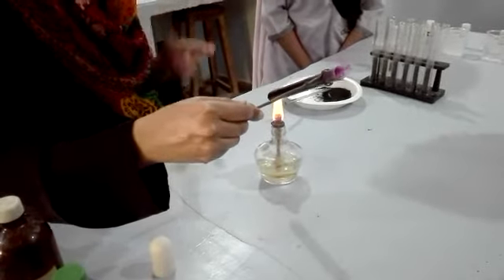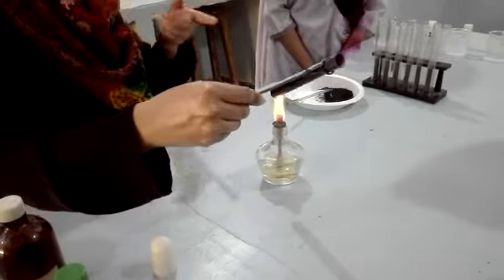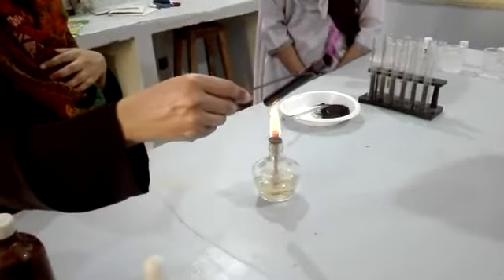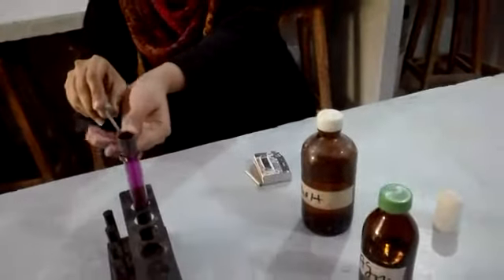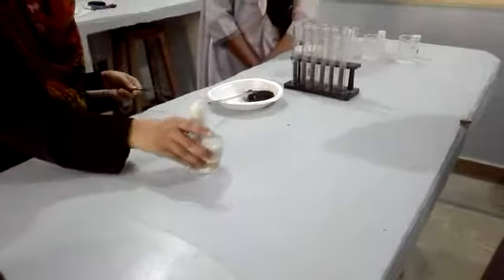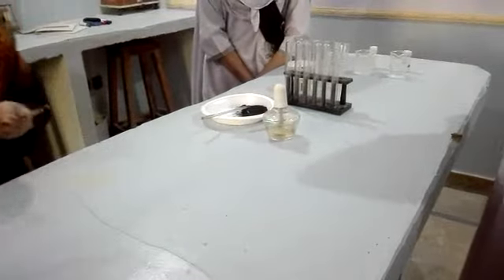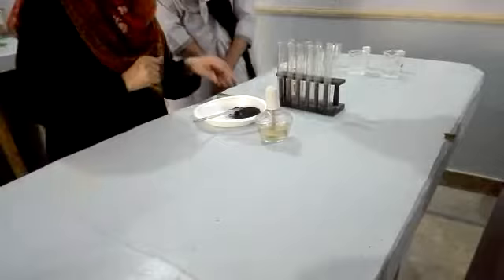So violet color fumes are now appearing — it indicates the presence of iodine. So this is actually one test you have just performed, but it is not confirmed yet. Although whenever violet color appears, it is the indication of iodine. Now you have to perform the confirmation test.